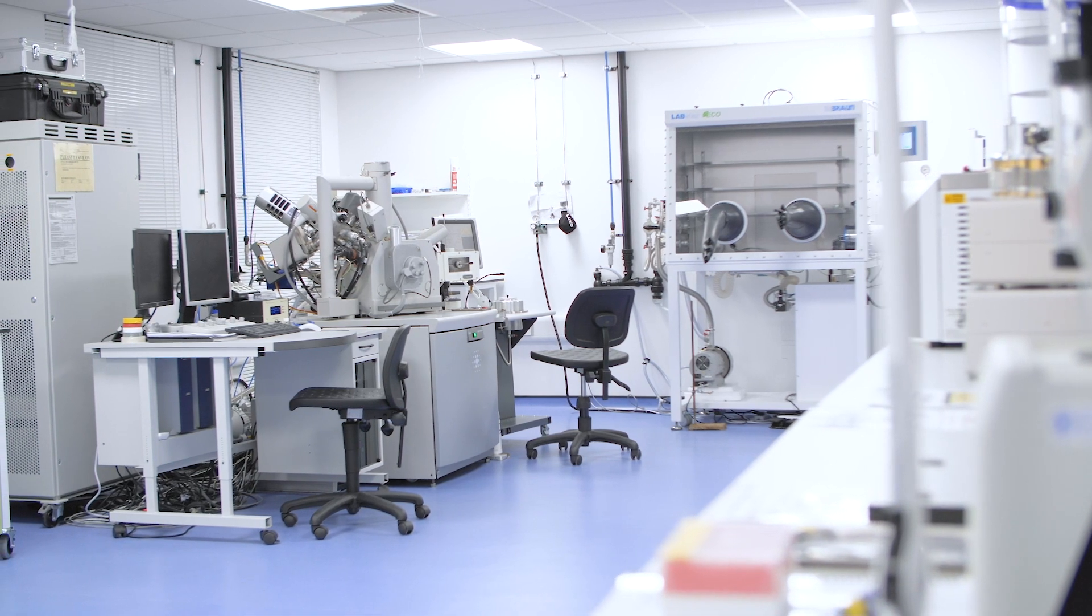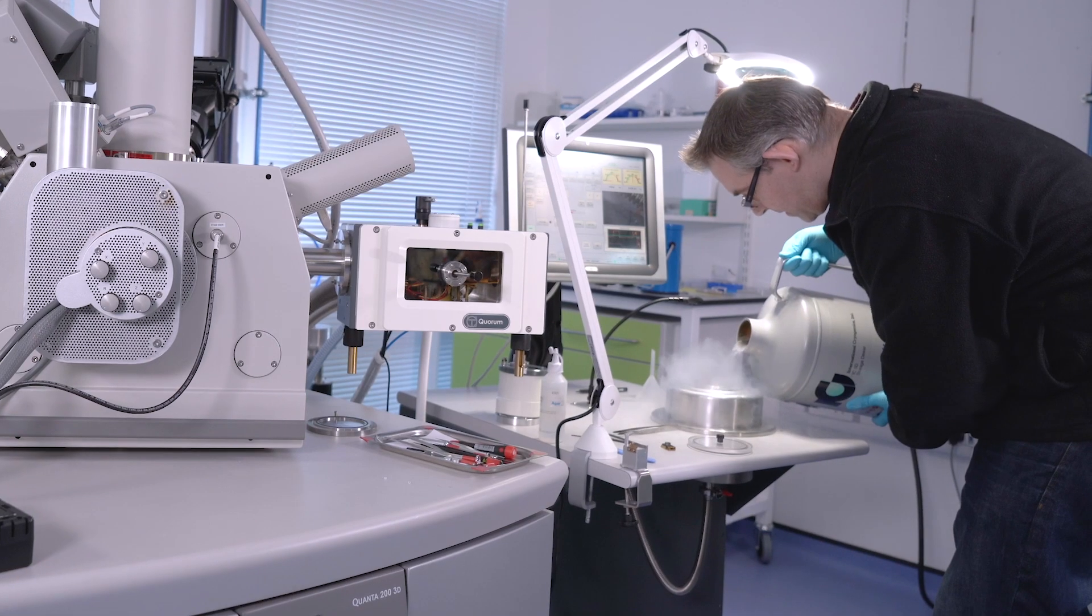So now we'll go over to the Quorum PP3010 and show you how easy it is to prepare a standard cryo sample. Here we are at the NMRC in Nottingham with Dr. Chris Parmenter, and he's just going to demonstrate producing a very simple cryo sample.